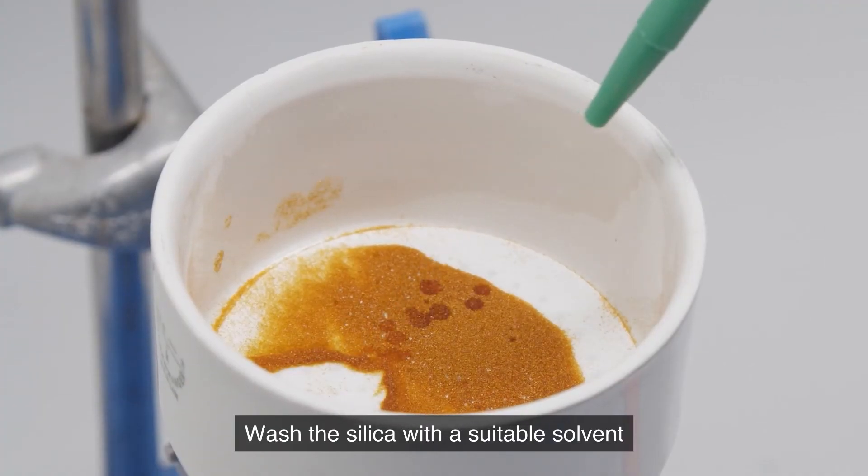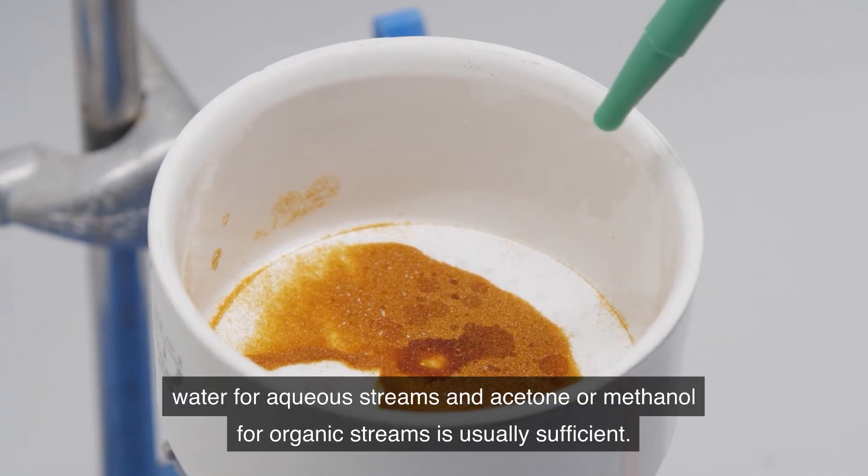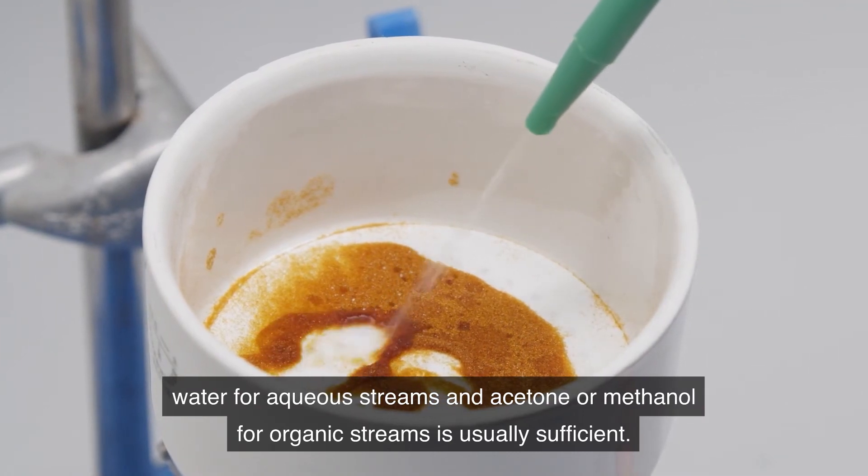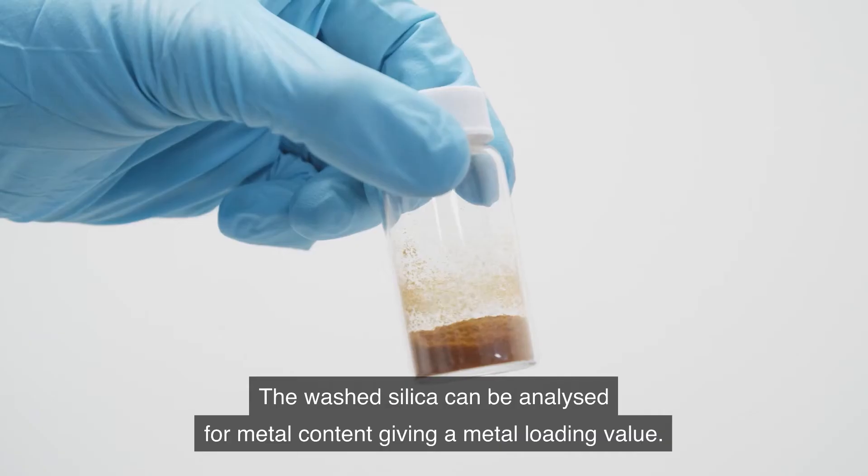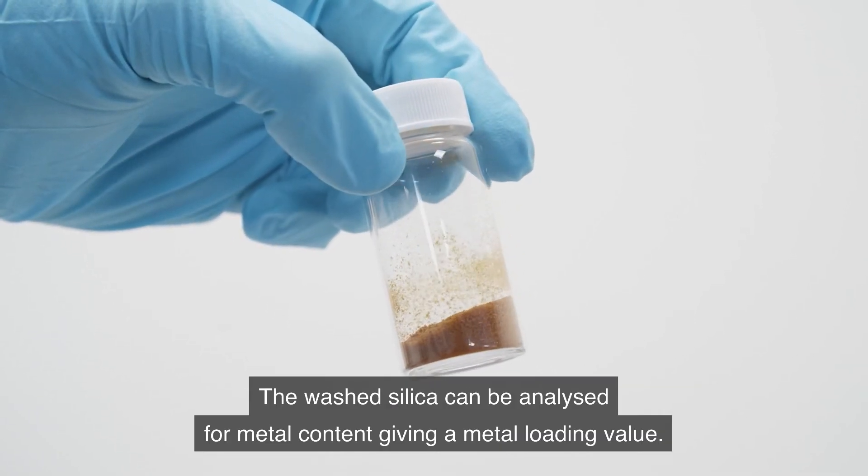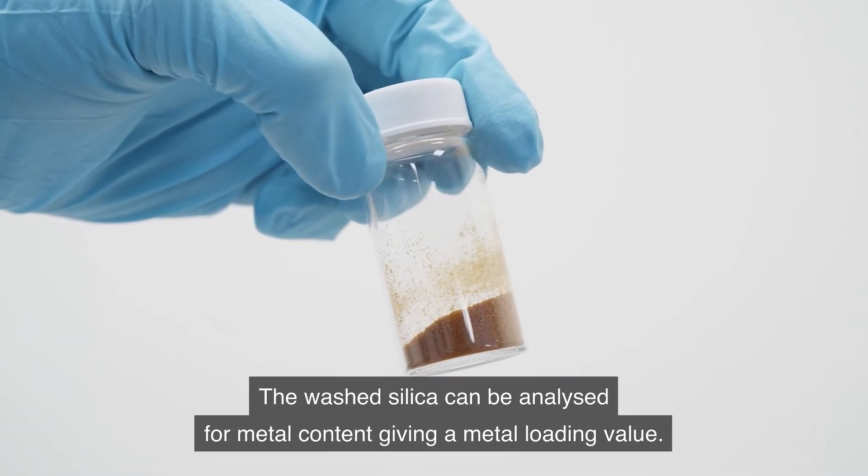Wash the silica with a suitable solvent. Water for aqueous streams and acetone or methanol for organic streams is usually sufficient. The washed silica can be analysed for metal content giving a metal loading value.